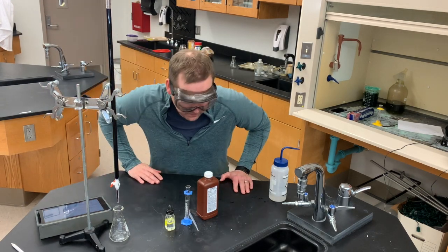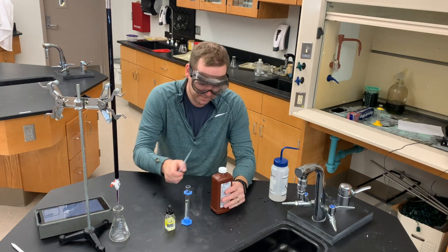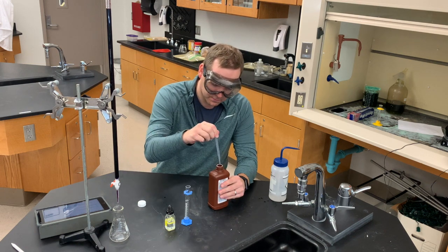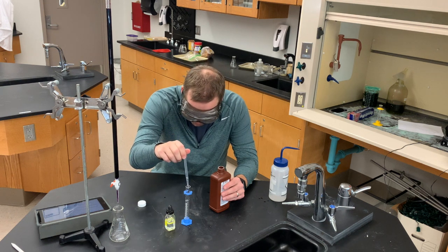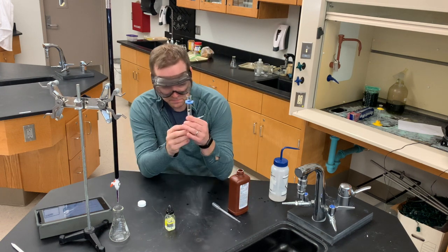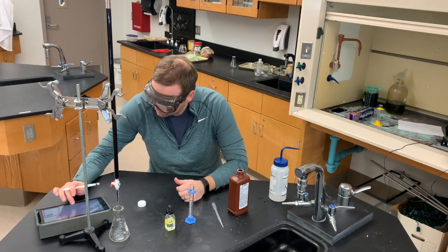All right, let's get started with the lab. Remember you need to jot down these steps to make sure that you document a procedure. I got my goggles, I'm ready to go. So the first thing I want to do is take the hydrogen peroxide and using a little plastic pipette, suck out approximately one to two milliliters and measure it out in this graduated cylinder. I double check to make sure I write down the exact amount of hydrogen peroxide and add it into my data table.